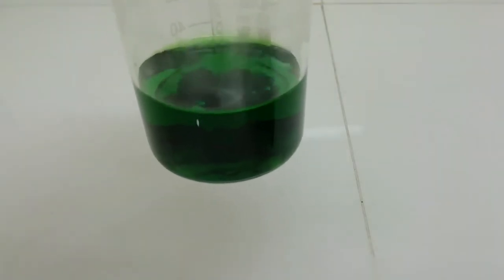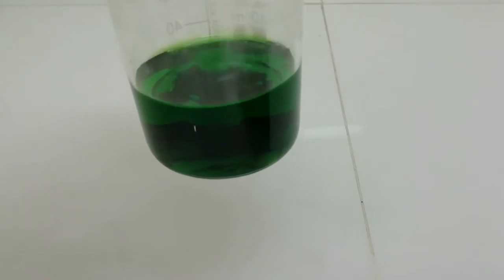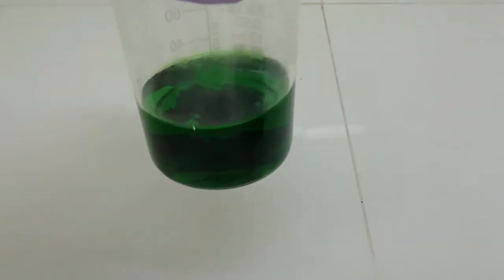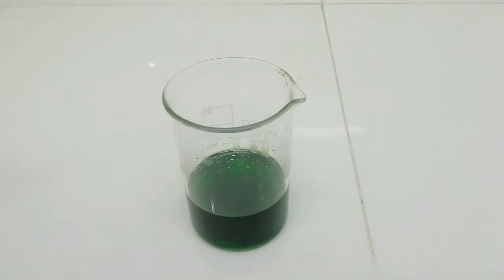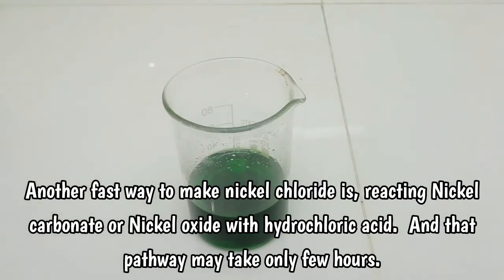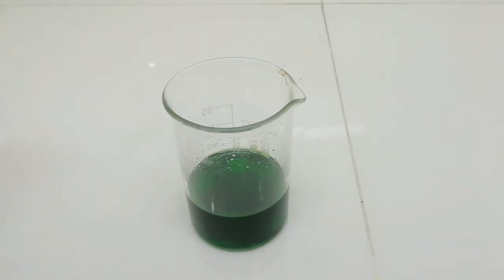I am going to filter this solution and continue the procedure with this nickel chloride solution. And I have to say, if you have nickel oxide or nickel carbonate, you can do the experiment with that. So if you don't have nickel oxide or nickel carbonate and you only have nickel metal, you can do the experiment with nickel metal.